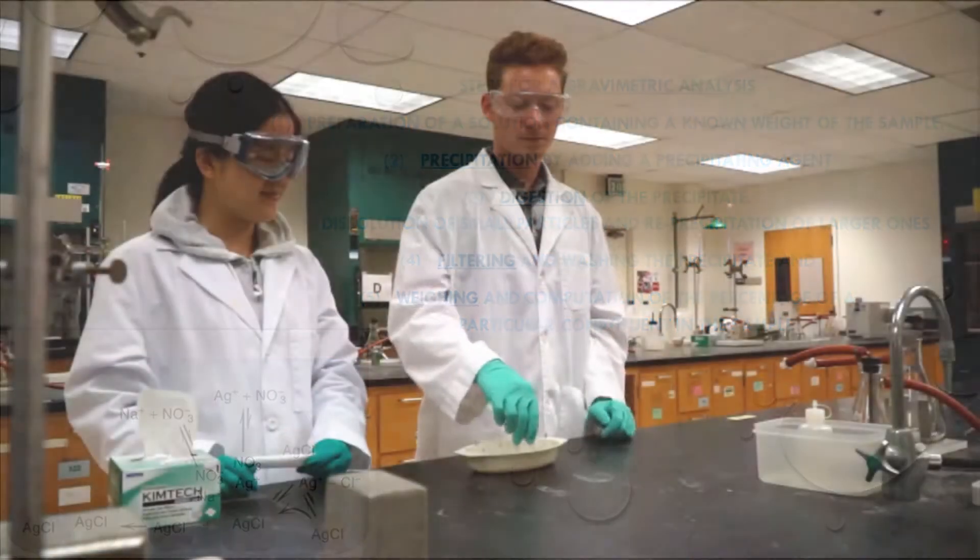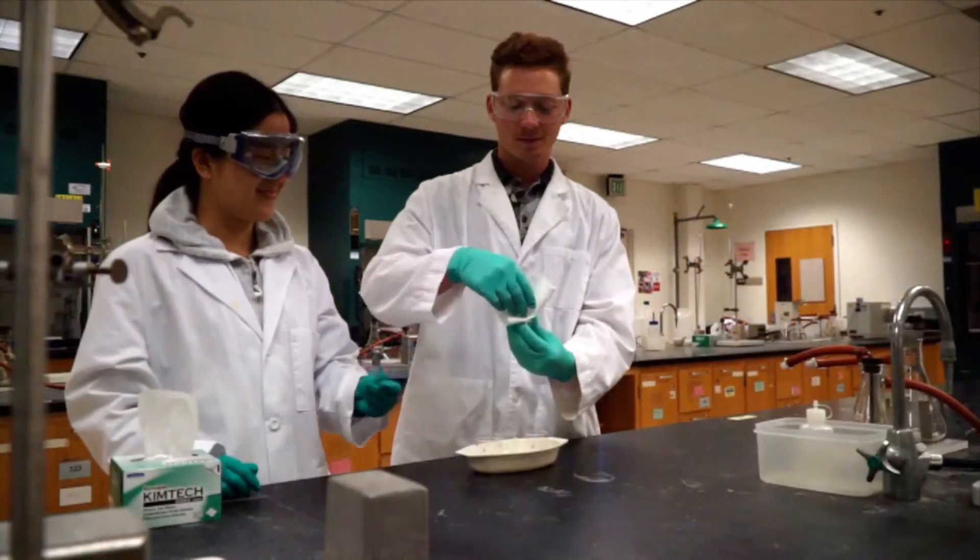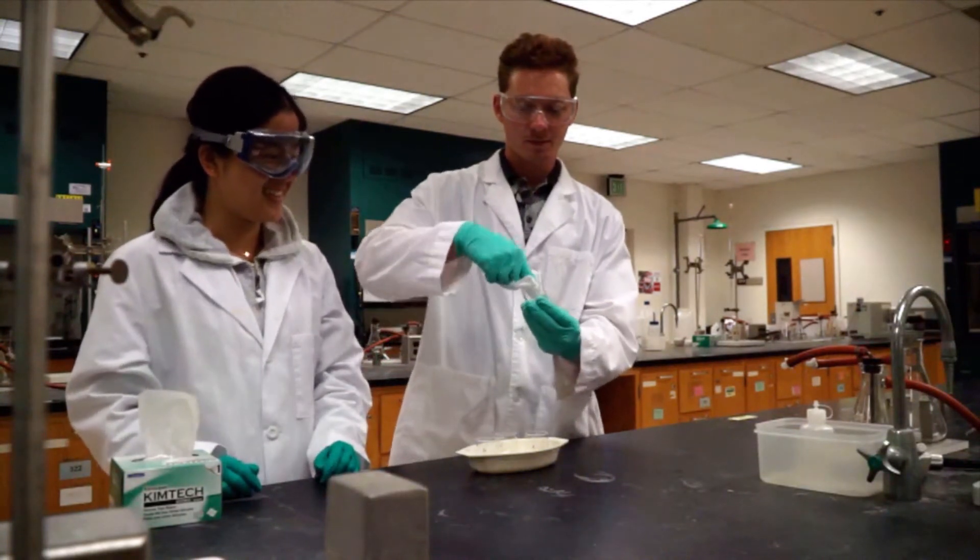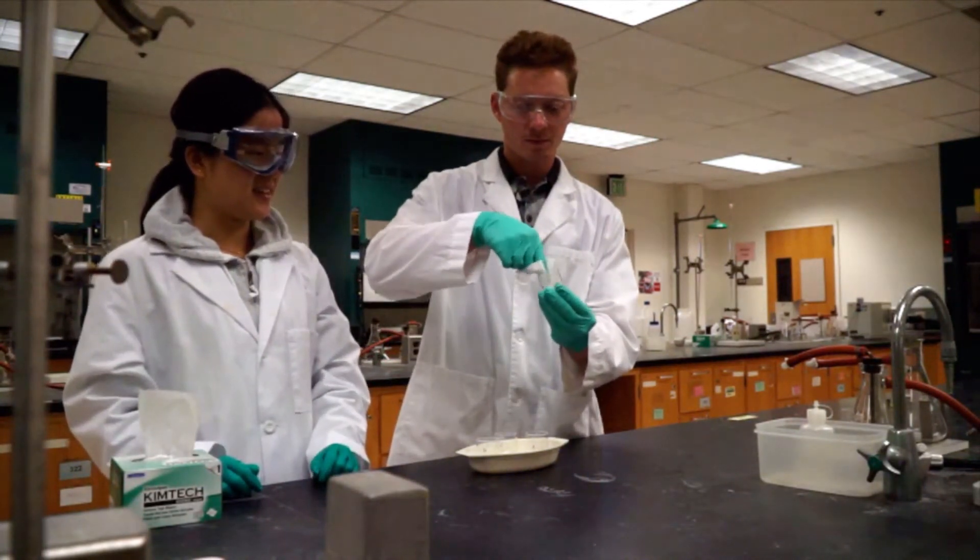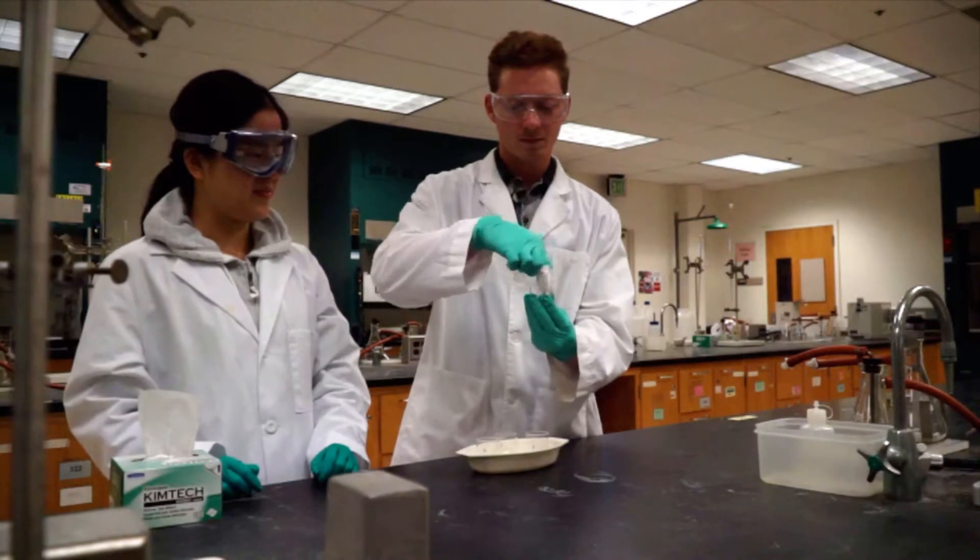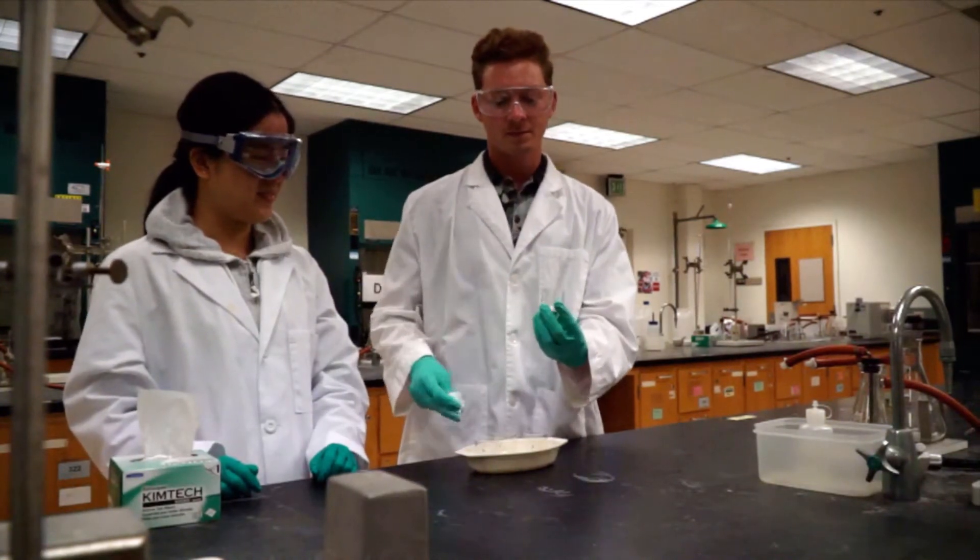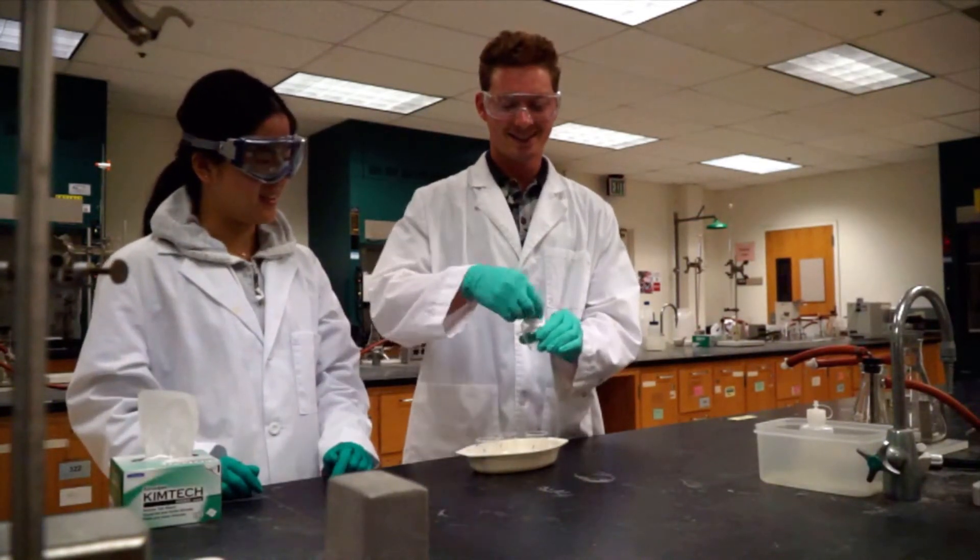This is a glass crucible. After rinsing the crucible with DI water, wipe the clear glass sides, avoiding contact with the frit so as not to clog it with lint. Wipe only the clear glass parts of the crucible.